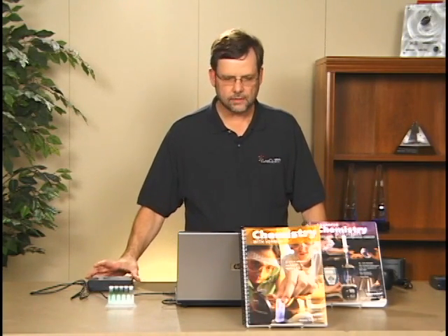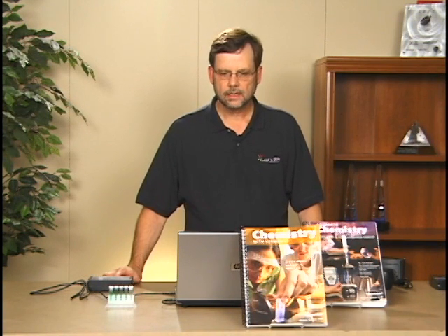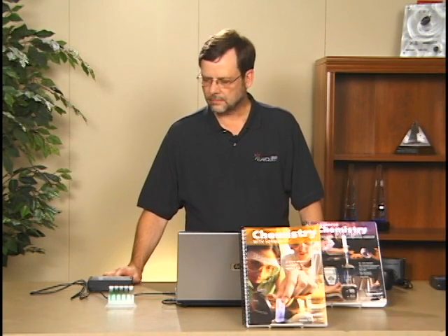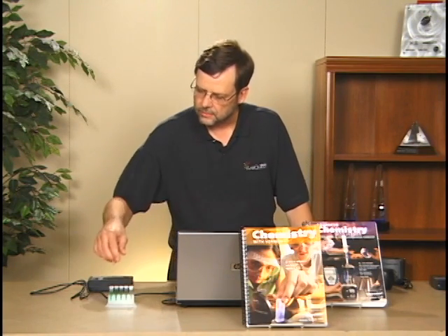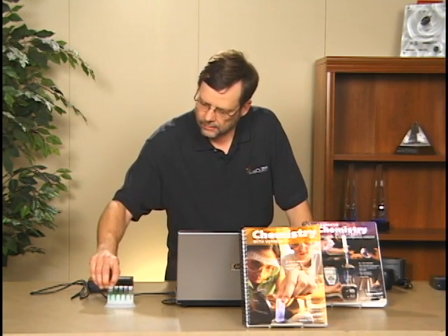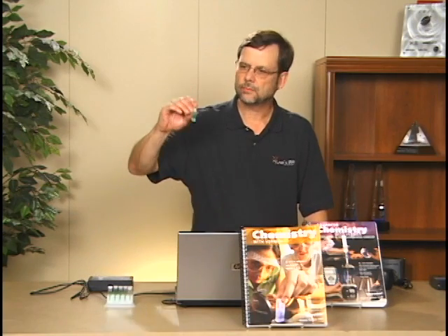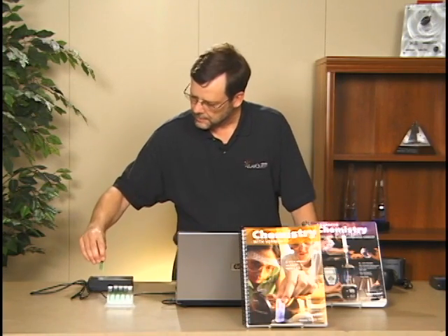Now, the thing that makes the array spectrophotometers nice is that in the past you always had to tell a student what wavelength they were going to do the particular experiment at, but here the student can determine that wavelength themselves. That's one of the beauties of this. And so what I'm going to do is take a sample of, I'll take one of my standards, the 0.40 molar, and I'm going to put that down into the cuvette slot, and I'm going to do a full spectrum of that.